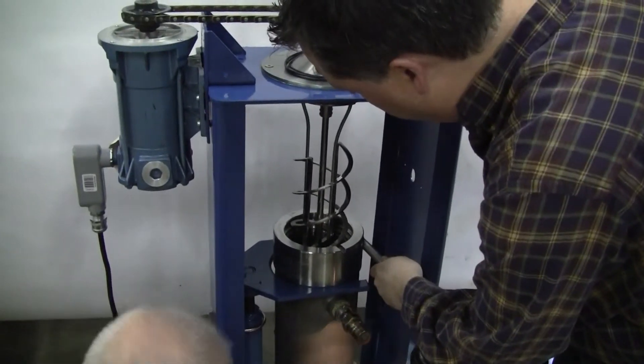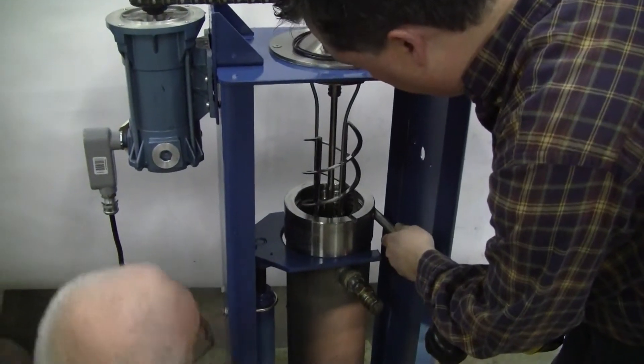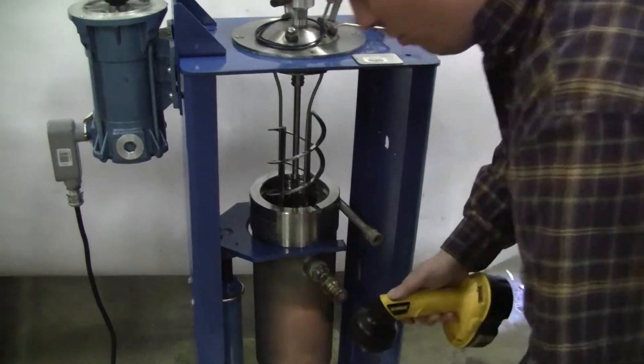We used a pair of pliers down below. That's fine, Sam, because what we're going to do is we're actually going to let it spin when we turn on the motor.